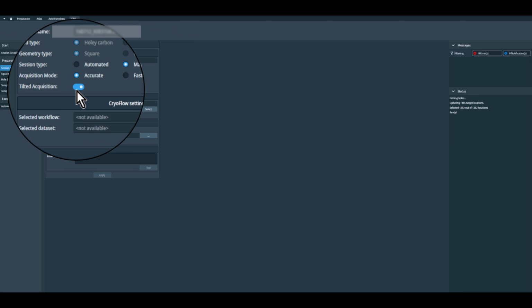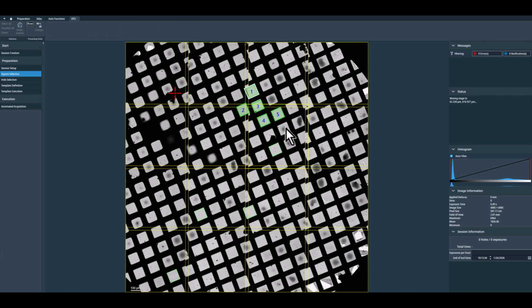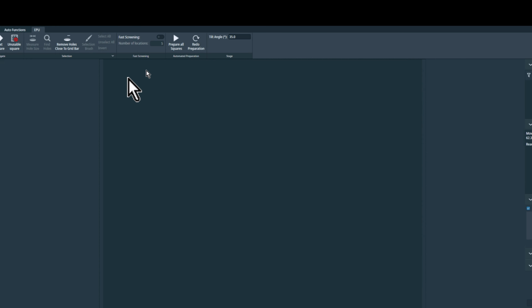Today we want to share a quick tip to help you deal with preferred orientation in Cryo-EM, especially when your grid is already loaded in the microscope. If you're using EPU, just enable tilted acquisition when creating your session. Then, when you move to a grid square and open hole selection, you see the tilt option available here.